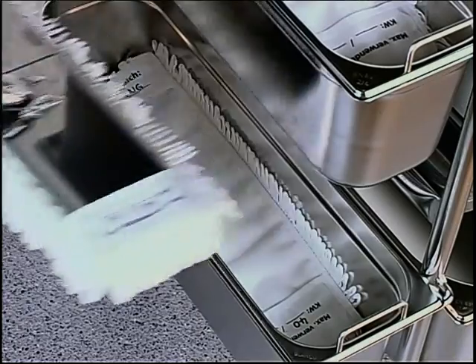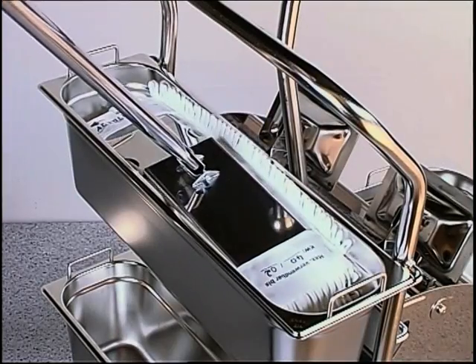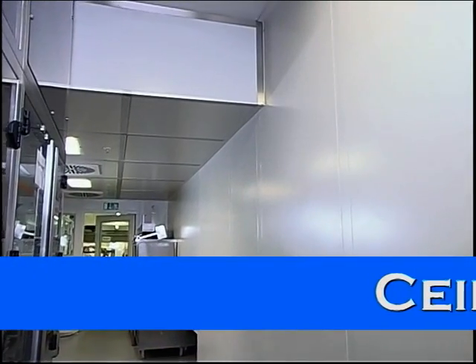One more time for practice. Drop the used mop into the lower container. Pick up the new mop from the upper container. Then we can carry on with the ceiling and the walls.